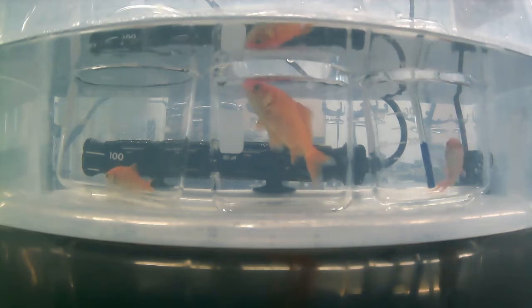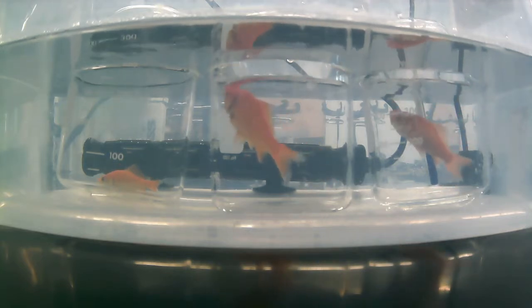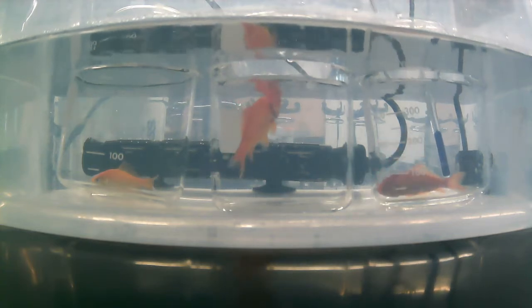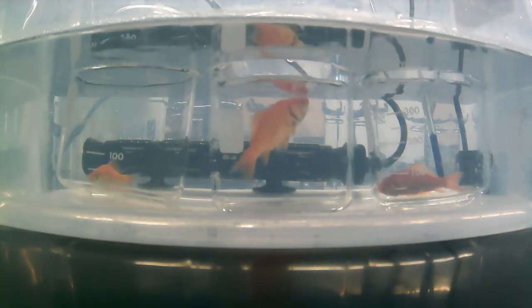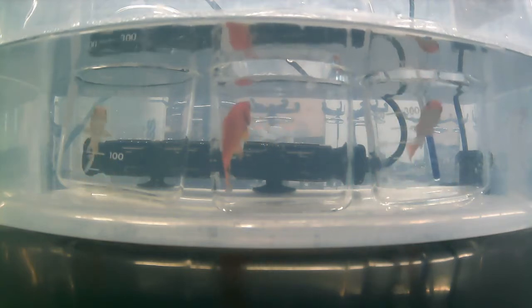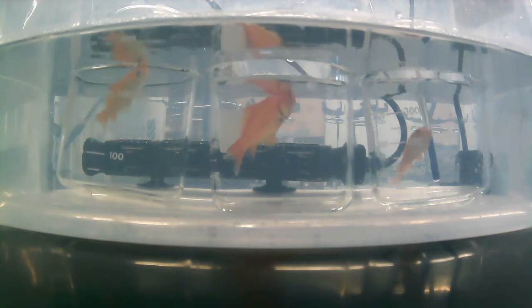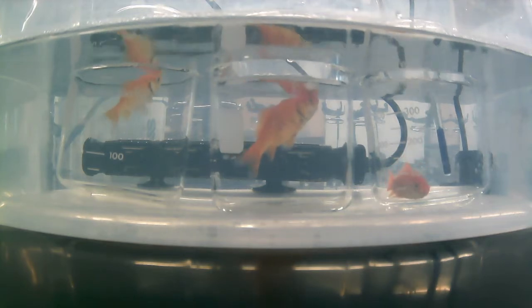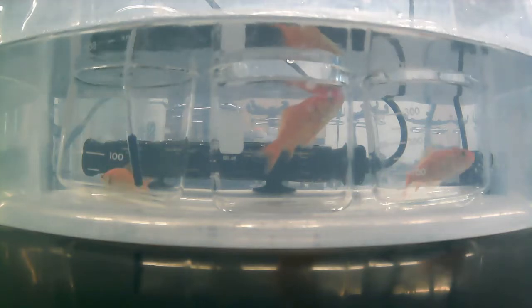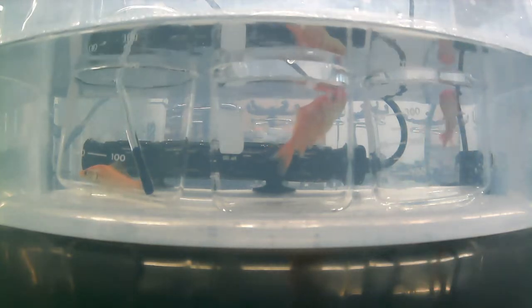that as they've adapted to a higher temperature, their LOE should have increased. So their critical maximum should have gone up with adapting to a higher temperature. And this guy is looking like he's at 36.2, which is about the same as yesterday, but we will keep an eye on the other two. They still look like they're still shrugging, so we will see how that ends up.